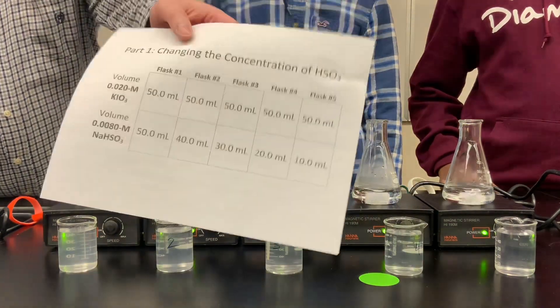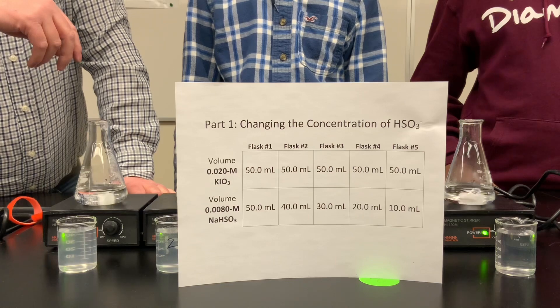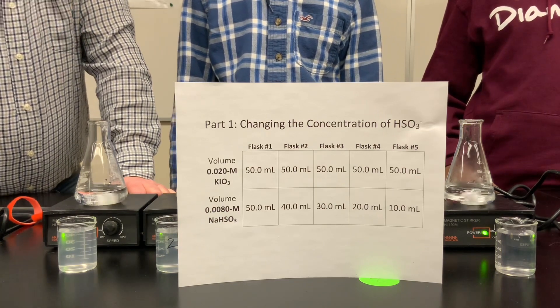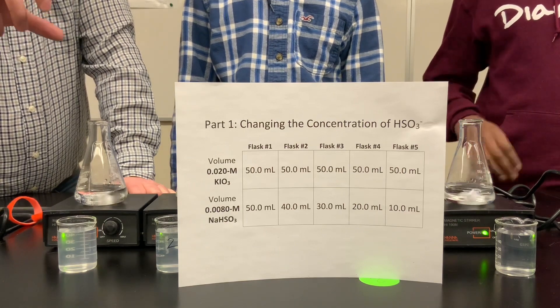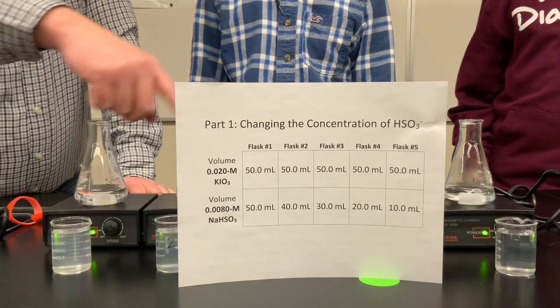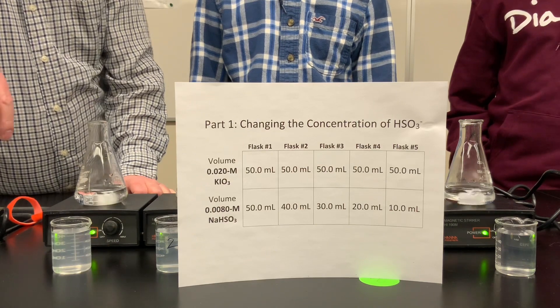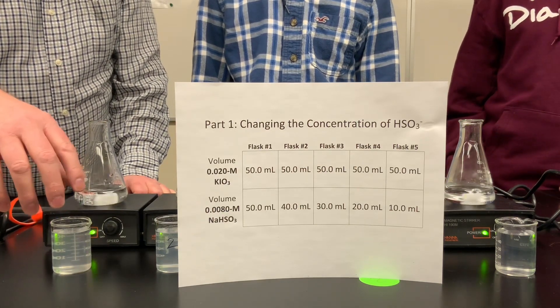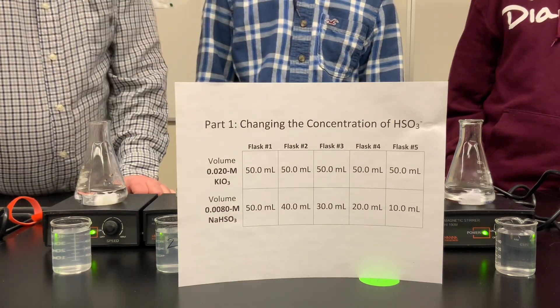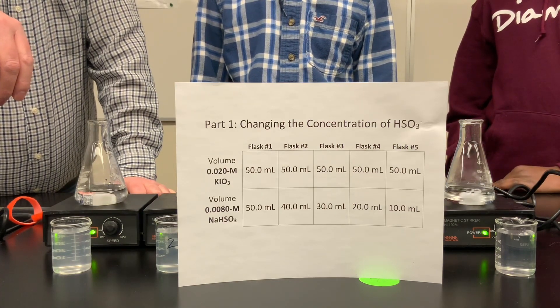There's a table showing what is in each of our beakers. We're going to look at the effect of changing the concentration of bisulfite on the rate of the reaction. We have five flasks, each containing 50 milliliters of 0.020 molar potassium iodate. The beakers have varying amounts of sodium bisulfite — starting at 0.0080 molar — with 50 mL, 40 mL, and 30 mL of bisulfite solution, topped up with water to give 50 milliliters in each beaker.